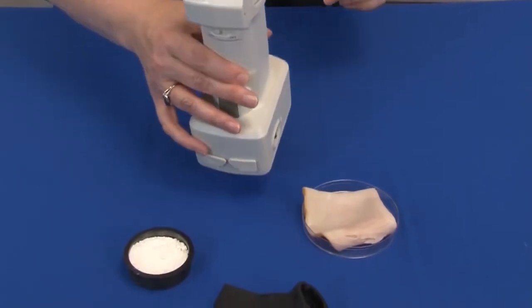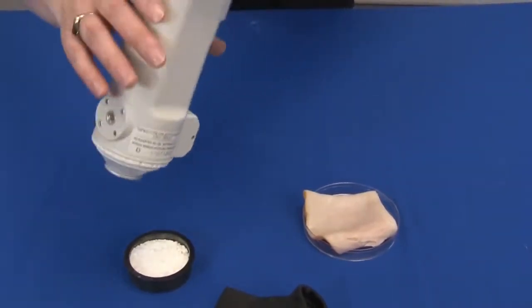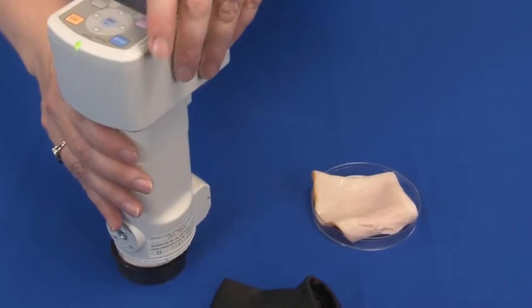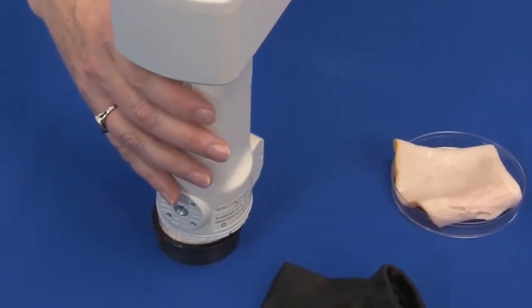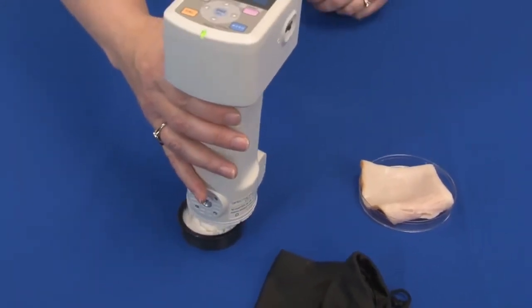The target mask is a simple attachment to your spectrophotometer. After securing it in place, measurements can be taken on powders or wet specimens without damaging the instrument.